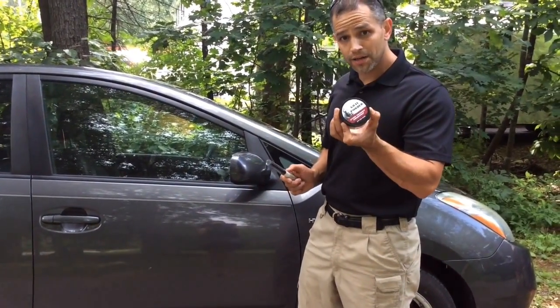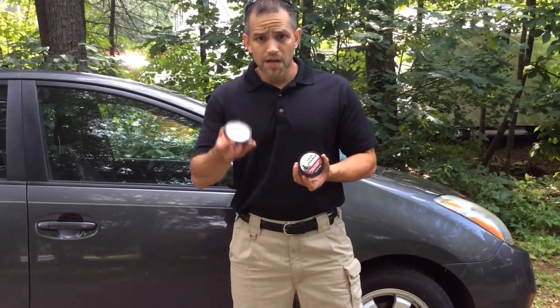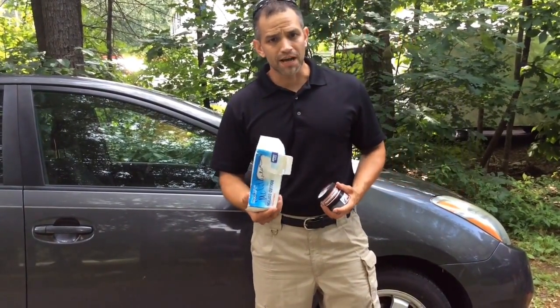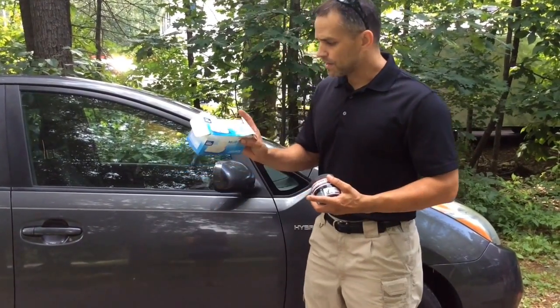You're still going to want to use a high quality powder, so I'm going to use a gray powder and I'm going to use an orange powder. The next thing I'm going to use is just some rolled cotton. I got this rolled cotton at the pharmacy and you can get it pretty cheap.